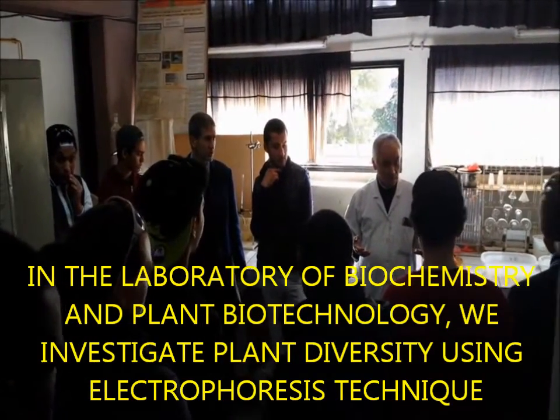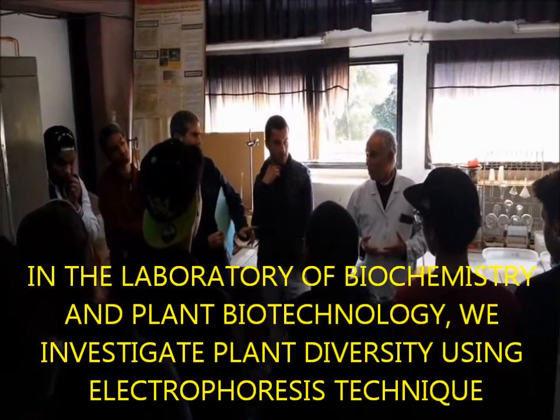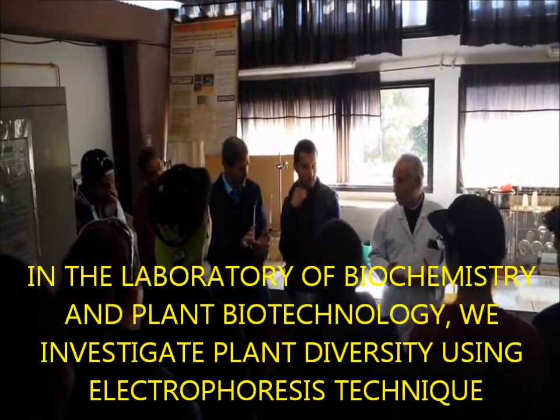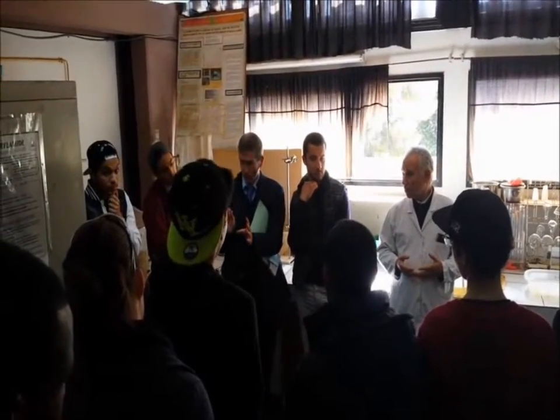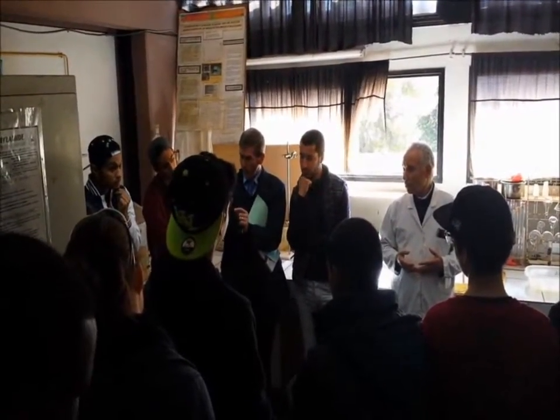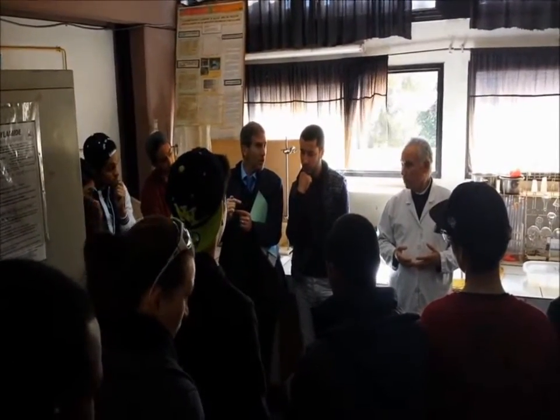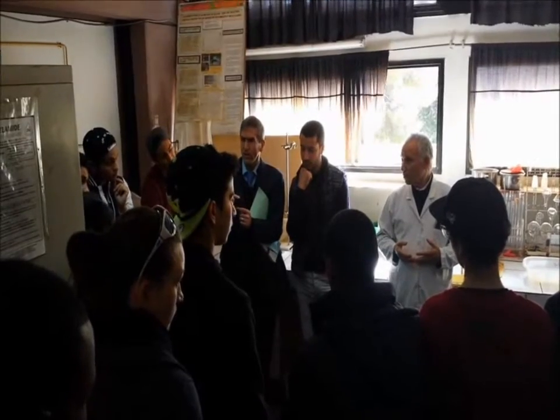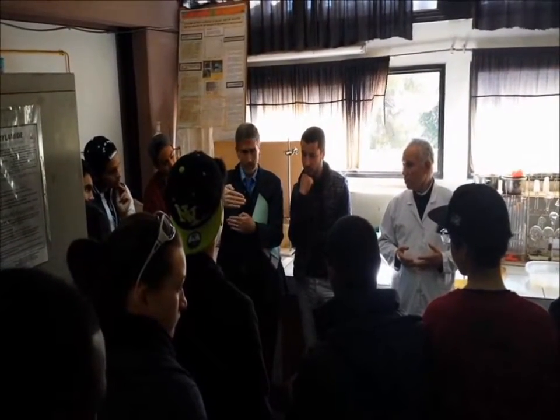Electrophoresis, you know what is electrophoresis? So basically in electrophoresis you have molecules, and according to how big the molecules are, they move at different speeds. And you've got an electric field, that's why it's called electrophoresis.